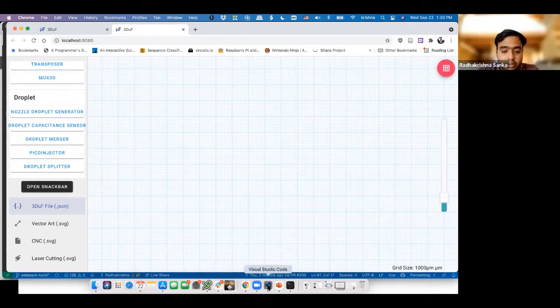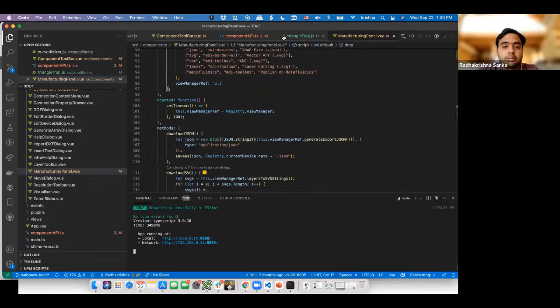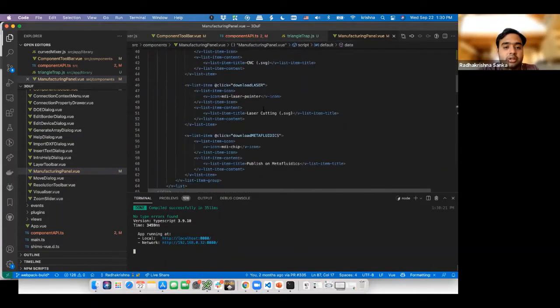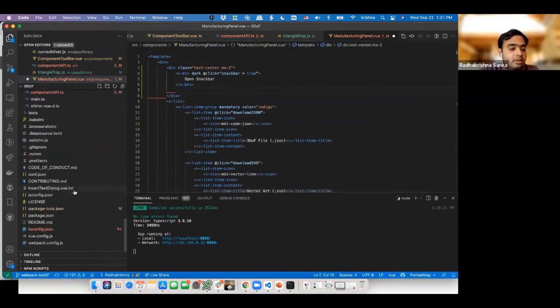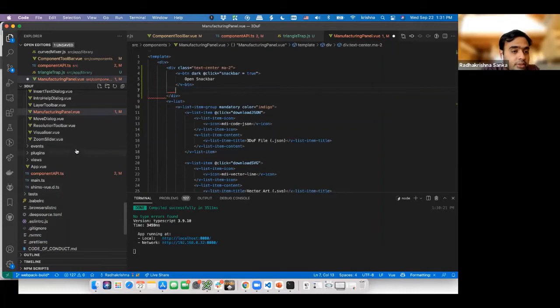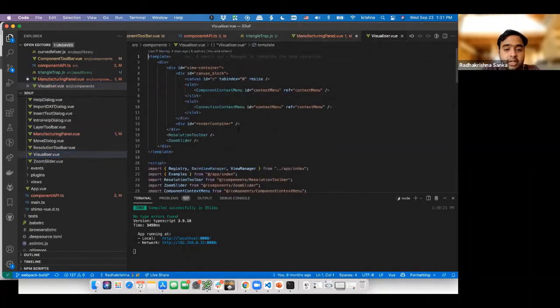So what we're going to do now is go back over here, back to the manufacturing panel button. We're going to look at the template and ask which part of this is the snack bar and which part is the button. Because this is the button and this is the snack bar, I'm going to take this and cut it out. And I'm going to go into the visualizer, because that's our entire grid which we show. I'm going to go down here and drop it here.